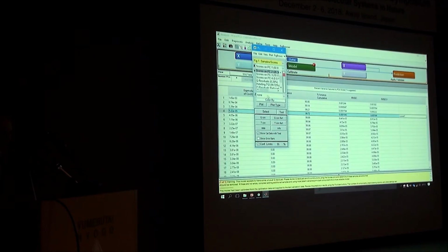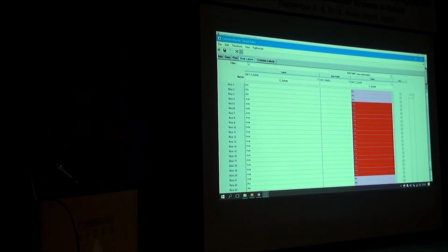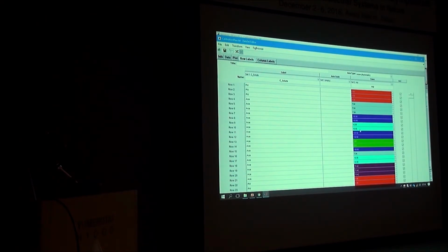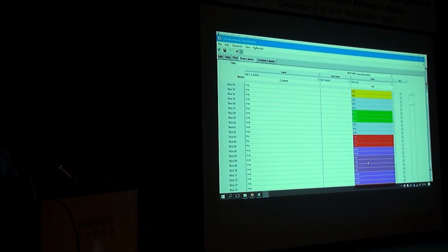So let me show you how the data is sorted. I'm just opening the data set. You can see there's a label there. And for the reps, these are all the same samples. So we color code them. All you need to know is that they are the same sample. You don't need to know anything else. My theory is you can use your old studies or different groups, they have their own data sets. Merge them together. As long as you know what samples are the same, different instrument effect, different temperature effect could be removed potentially. I think this meta-analysis could be very valuable. And you don't need to design a new set of experiments. You use your old data sets for better results, hopefully.